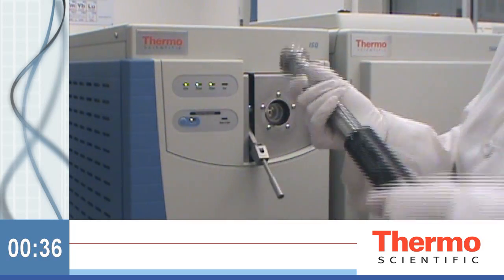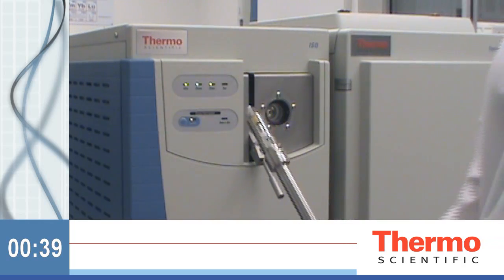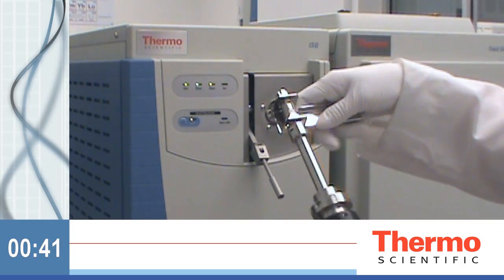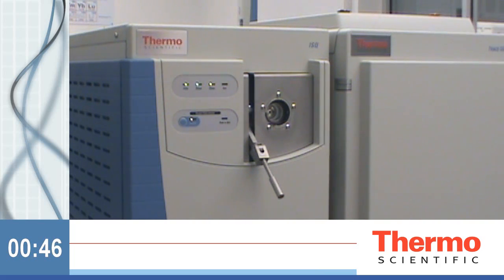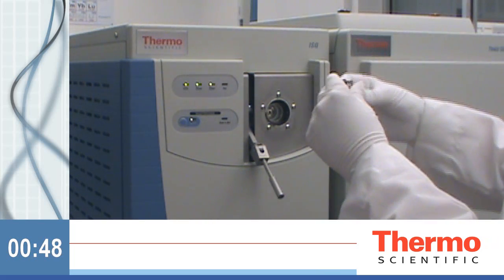You won't have to worry about venting your system. You can't take the tool off while the valve is open. Close the valve and remove the tool. Yes, the source is hot, but a simple tool allows you to safely remove the source and set it to the side.